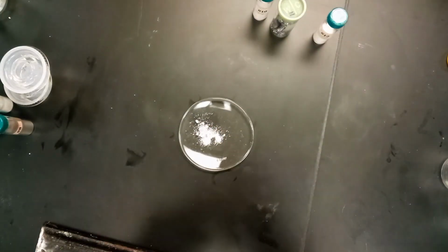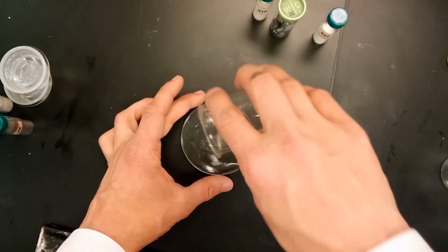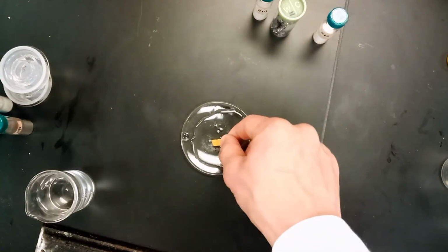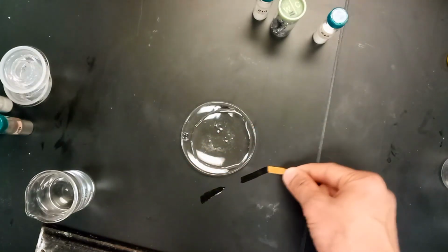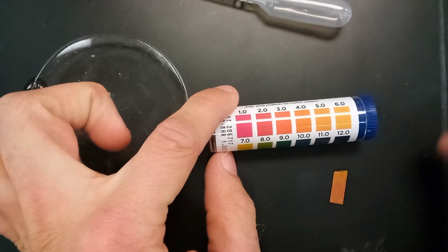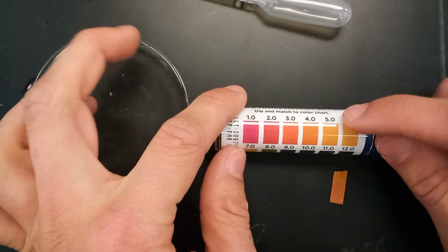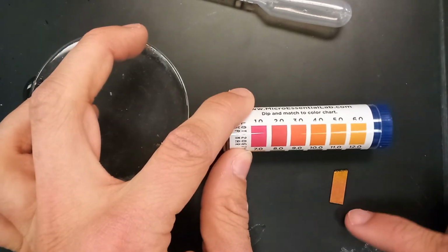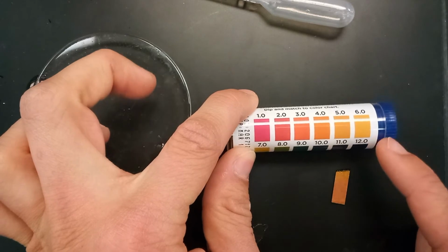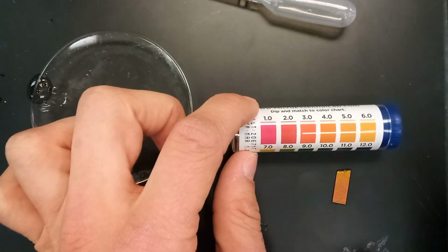So we'll put some of it there, then we'll add some of our water. First, it's important whether or not it dissolves, so we'll let it sit just for a second. And then we can take one of these pH strips, get a little bit of it wet, take it out. We'll compare the pH strip color to the colors that we see here. So we've got the solution of number 9 on a pH paper here. We're going to try to match up the color. It's orange, it's kind of dark, it's a little wet, that affects it a little bit, but we think it's probably somewhere in between 5 and 6. So not too acidic, but slightly acidic, more acidic than regular distilled water would be.